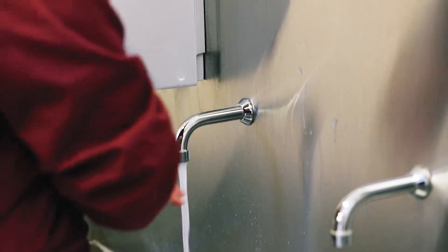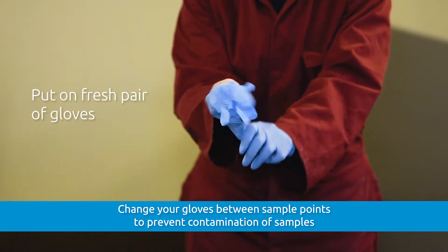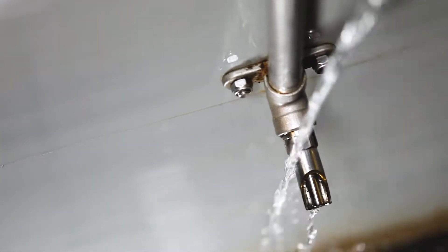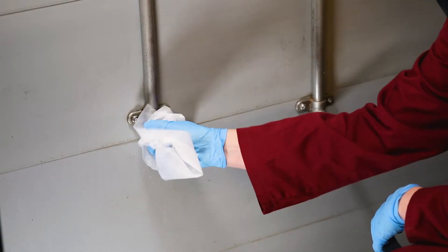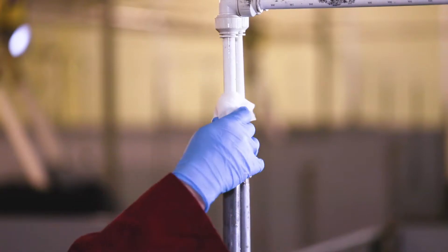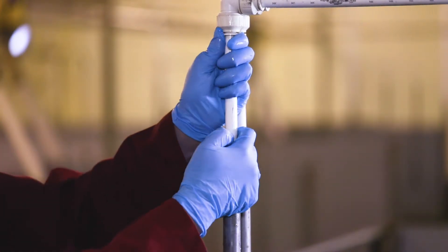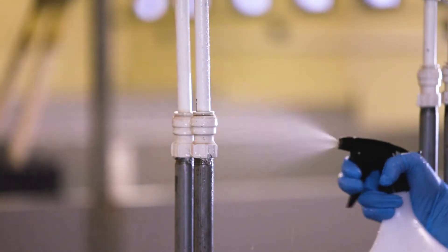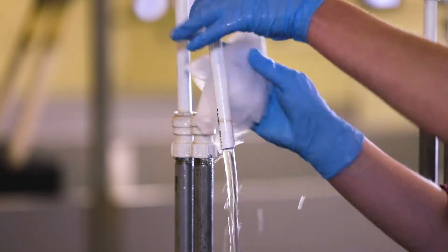Next, go to your first sampling point. Put on a fresh pair of disposable gloves before you start and remove any obvious contamination, grease or slime from the nipple or around the area where the sample is to be taken. If dismantling pipework, clean the adjacent pipe first to reduce the risk of dirt and debris contaminating the sample. Once you've done this, spray sodium hypochlorite solution to sterilise these surfaces.